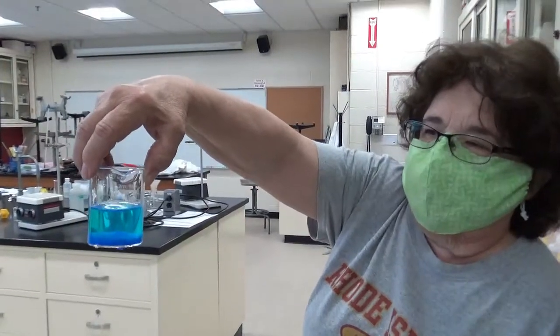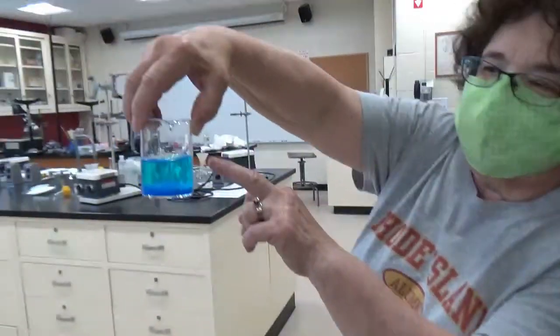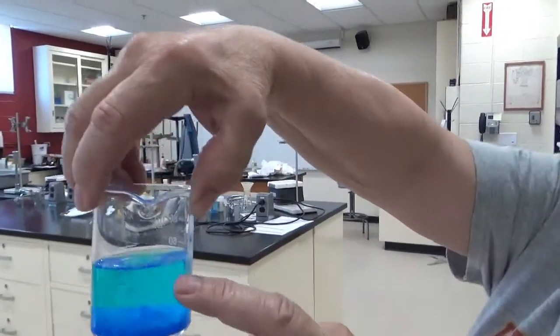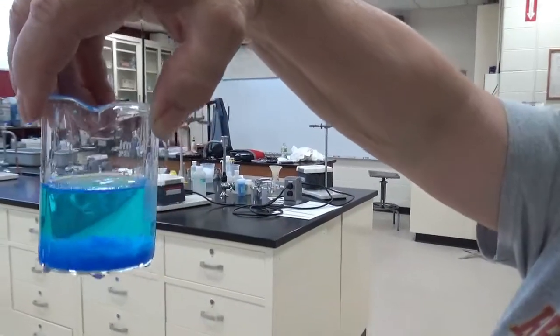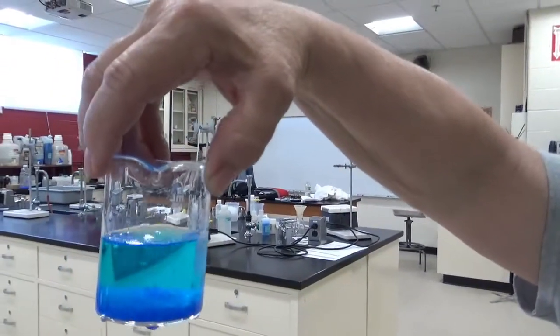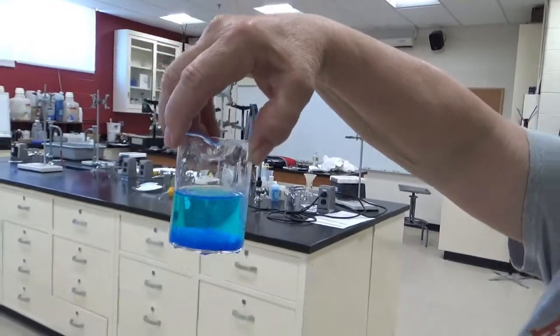So what we're going to do is we're going to cool this off a little bit more. You notice how blue the solution is. That means there's still some of this product in the water. So I'm going to put this in an ice bath now.